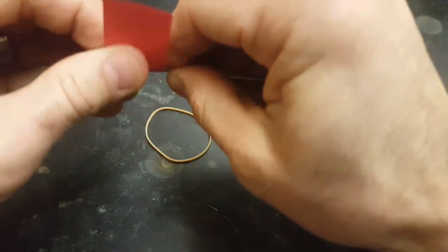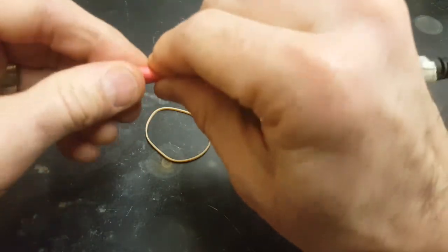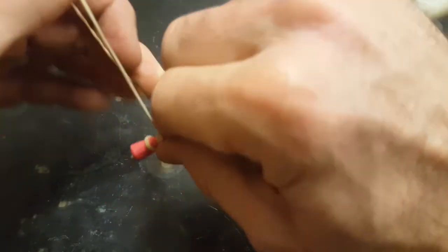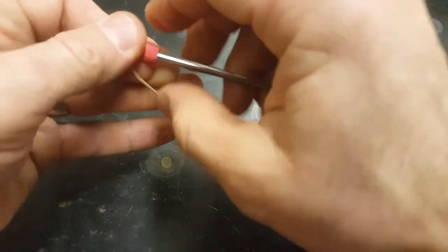This is going to be the sponge that absorbs the alcohol, from which the alcohol will evaporate. And as it evaporates, we expect it to rob heat from the thermoprobe, lowering its temperature. And that's how we're going to measure the different rates of evaporation today. Faster rates should see a more extreme and faster temperature change.